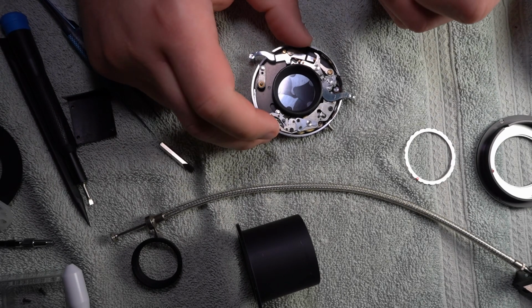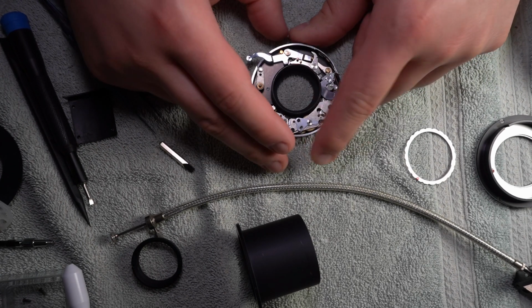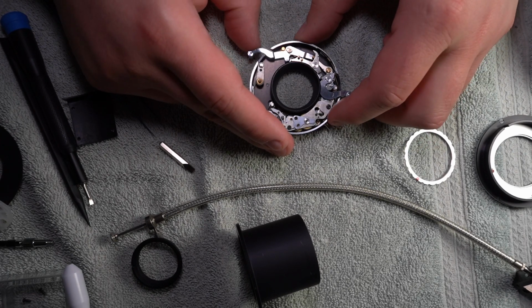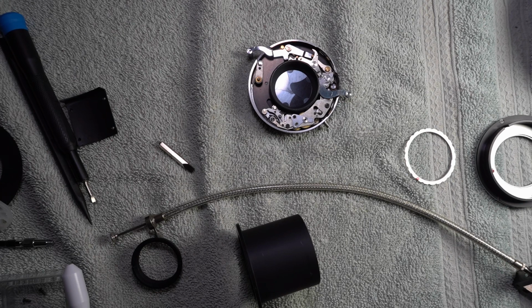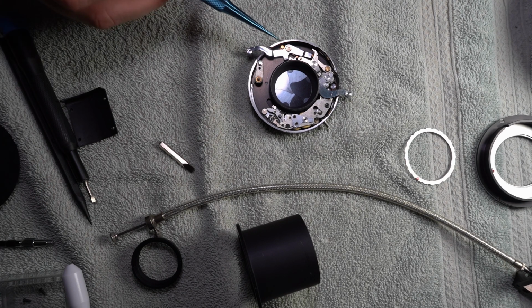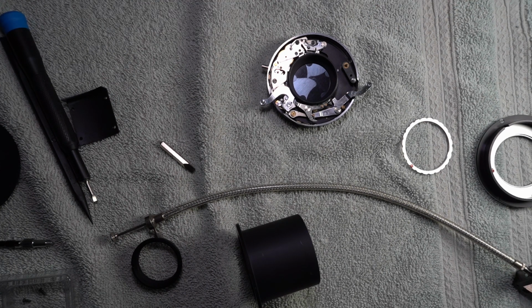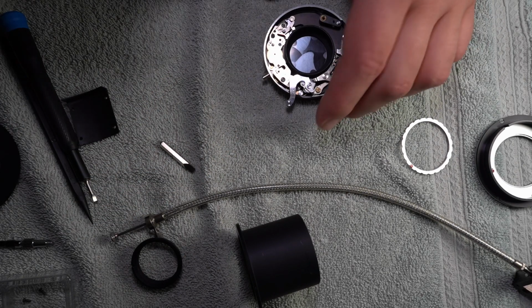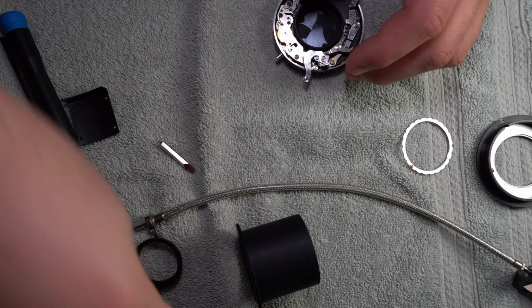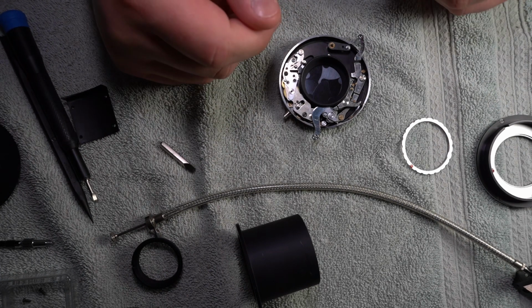Okay, so now we're going to test it and see what happens. Oh man, that is way better. Perfect. I'm going to put a tiny bit on the pin in here. Okay, so that's done. And actually, I should have done this before because I left this out like this all night, which was really stupid. But I'm just going to blow out this mechanism. But I don't understand any of this mechanism really.